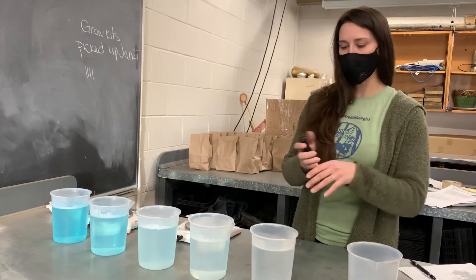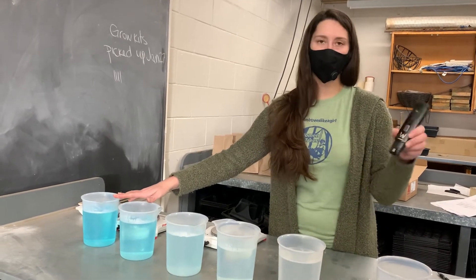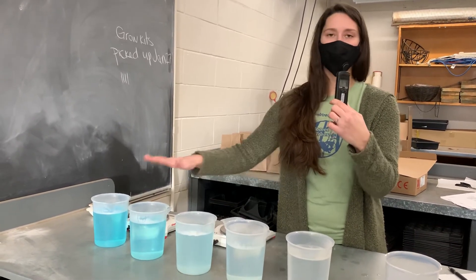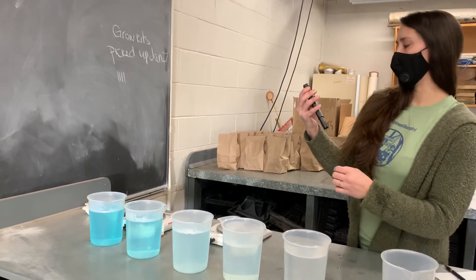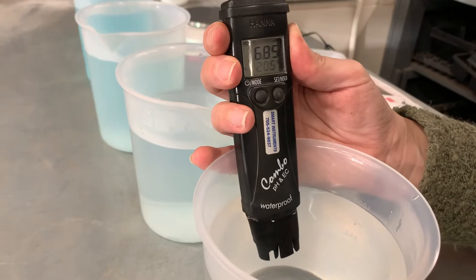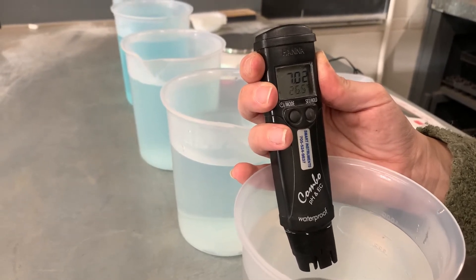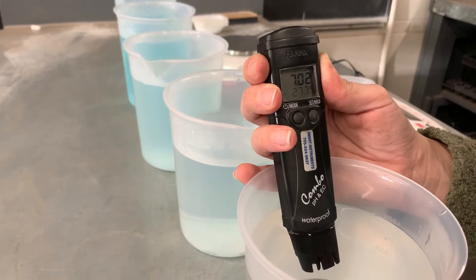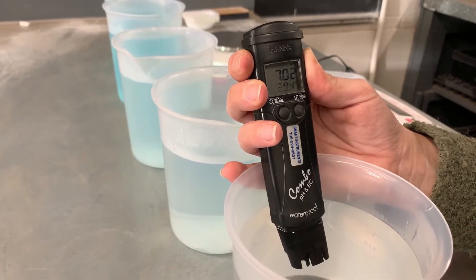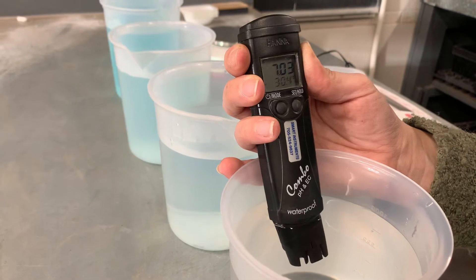Now we can measure the pH, and we're going to start with the water and move to the increasing values. That way we don't have to rinse our pH pen in between, because whatever the pH is doing, we're going to be going in a consistent direction. We've got our mode set to pH — we're just going to set this first in the water. It's going to take a little while and bounce around a bit, but it's good for you to see what happens with these instruments, because if you end up using one on the job, you'll know what to expect. We're just waiting until the bouncing stops, and then we can read the pH value.